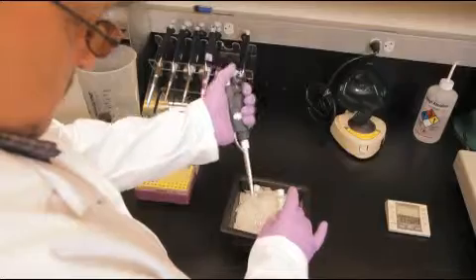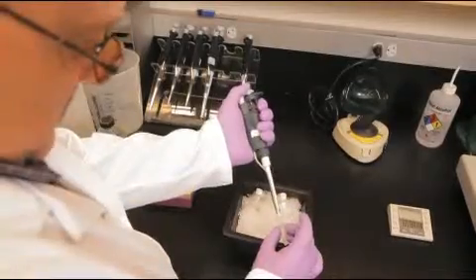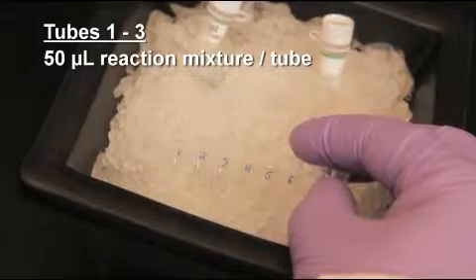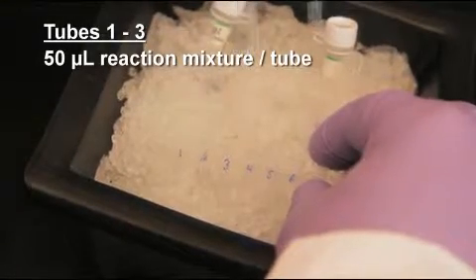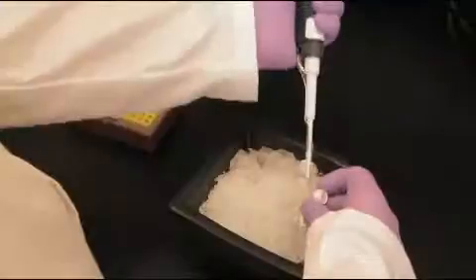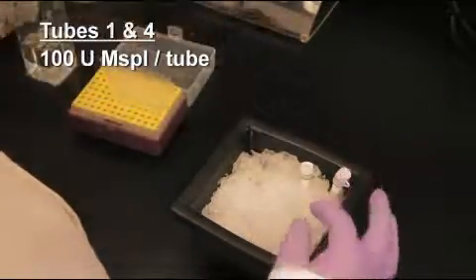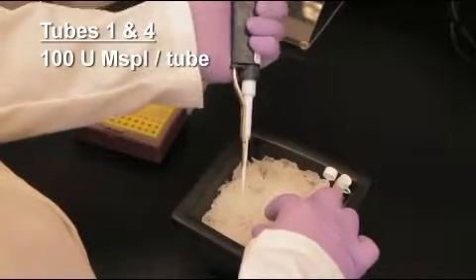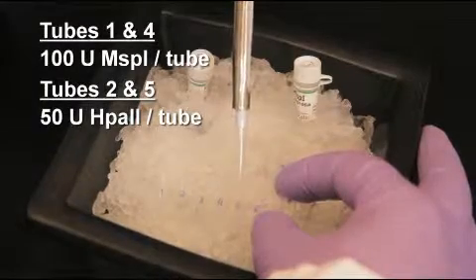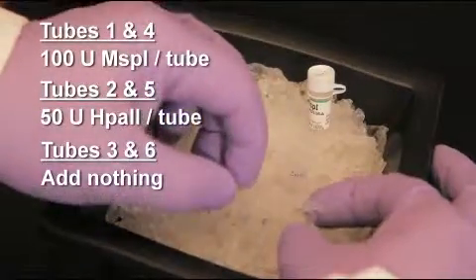To begin the restriction enzyme digestion, aliquot 50 microliters of the reaction mixture into each of 3 0.2 milliliter PCR strip tubes labeled 1 through 3. Then aliquot 50 microliters of the control mixture into each of 3 PCR strip tubes labeled 4 through 6. Add 100 units of MSP1 into tubes 1 and 4. Next add 50 units of HPA2 into tubes 2 and 5 and mix well by gently pipetting up and down. Do not add anything to tubes 3 and 6 as they are controls.